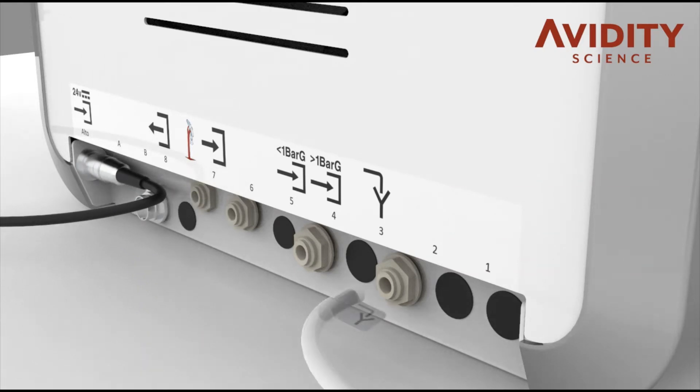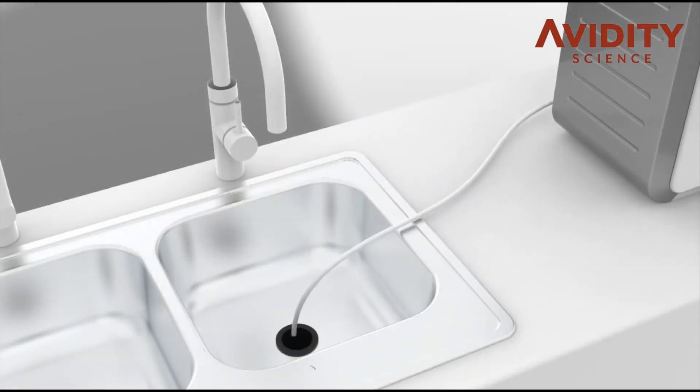Match the drain symbol on the tubing to the symbol on the unit and direct the discharge tube to a suitable drainage point.